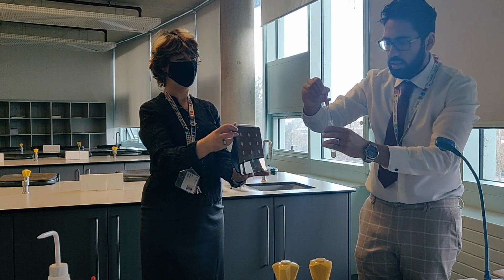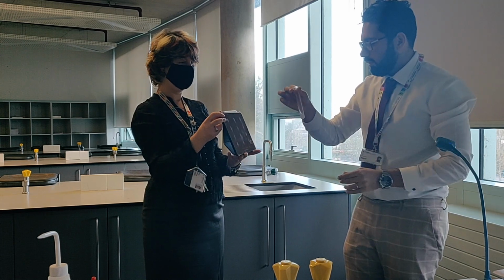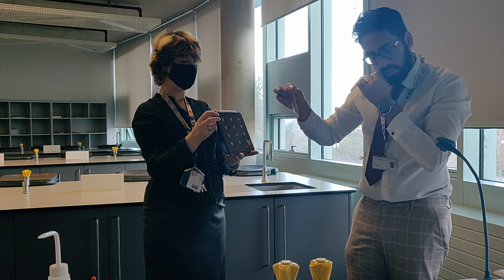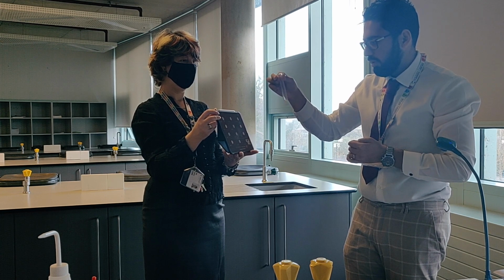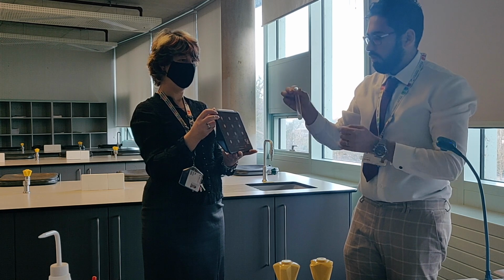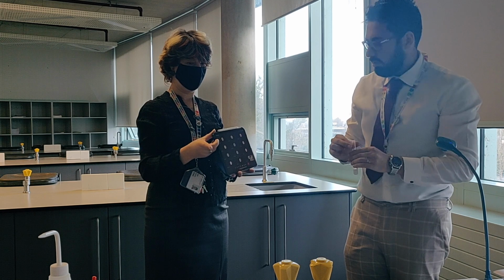So again, you should see white precipitate being formed. You're adding barium chloride to magnesium sulfate, and you're adding it in the presence of hydrochloric acid, producing barium sulfate. So it's a white precipitate being formed again. Remember this is the one that's using X-rays. Right, that was test 6.